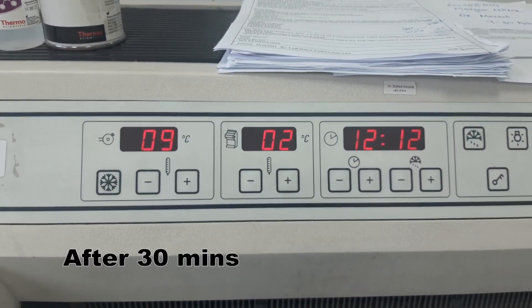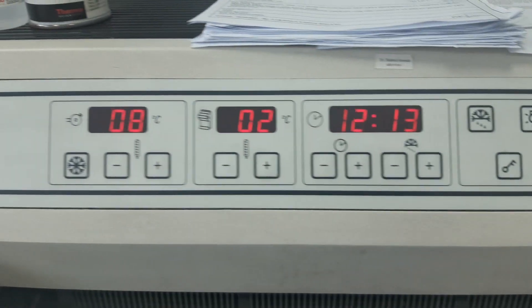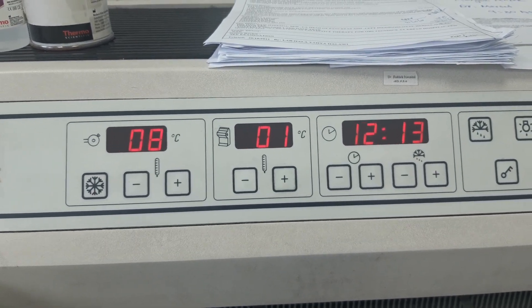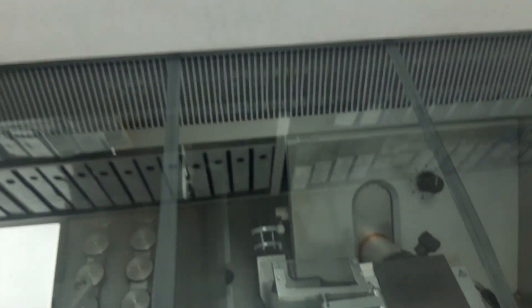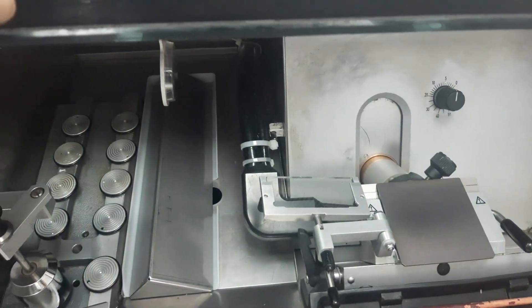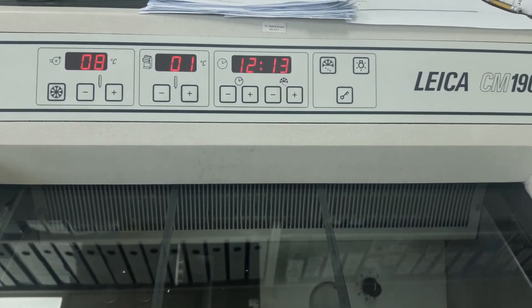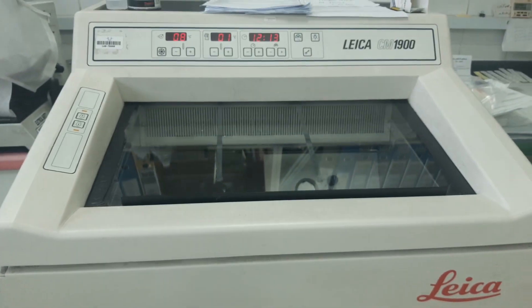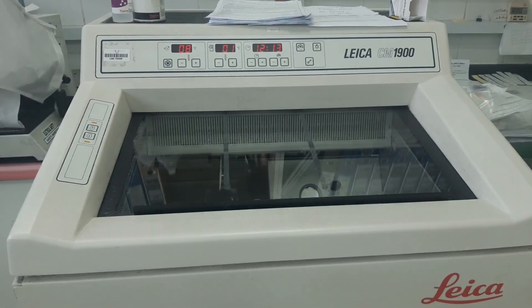As you can see the temperature is already going down. Later this area will be freezing when the temperature goes down to minus 20 degrees up to minus 30 degrees. This machine is good now and the user can use it — it just needs time to go down totally.